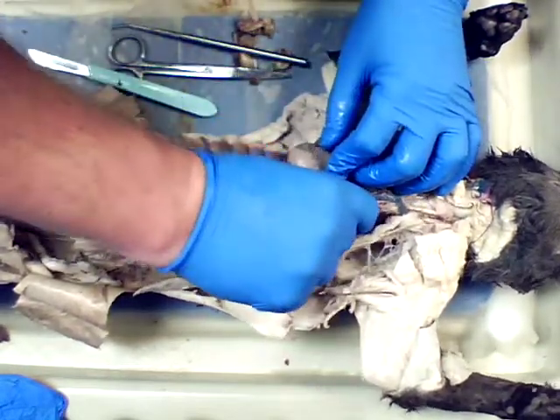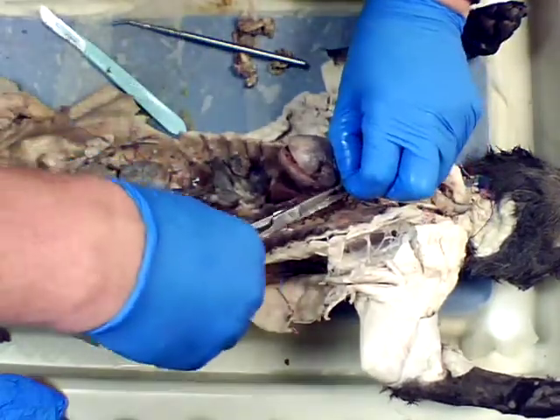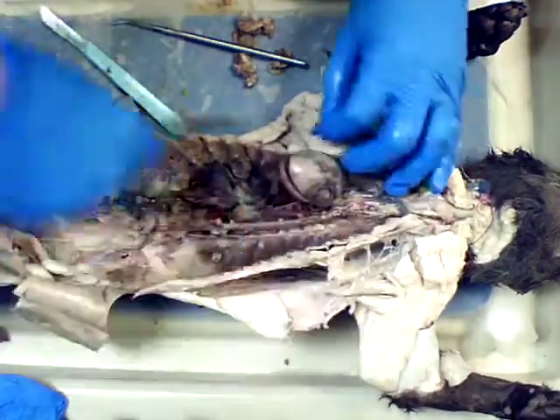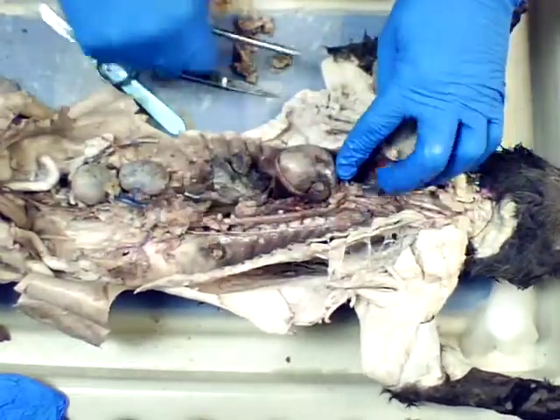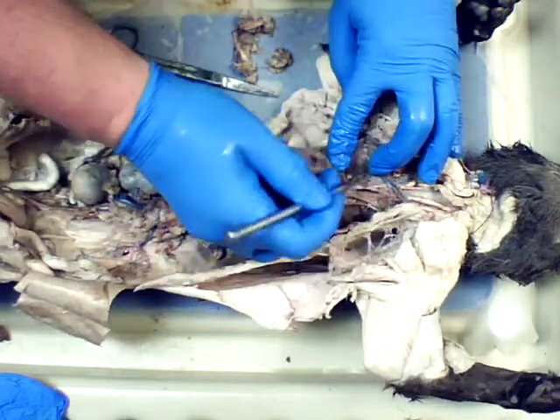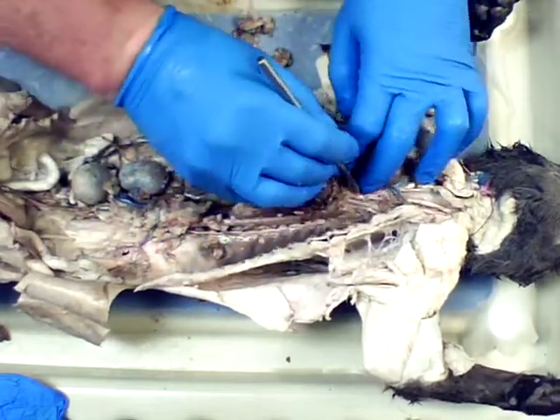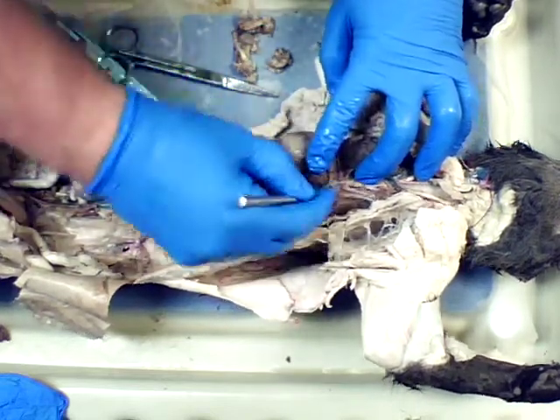So if I get into here with a pair of scissors to cut away some of this remaining pericardium, get this fat and other material out of the way, I can start to expose the aortic arch. So there's the descending. There we go. There's the branches off of the aorta right here in pink. I'm going to get all of them here so we can expose this aorta, move this heart out of the way here.